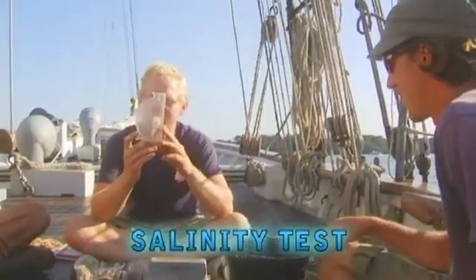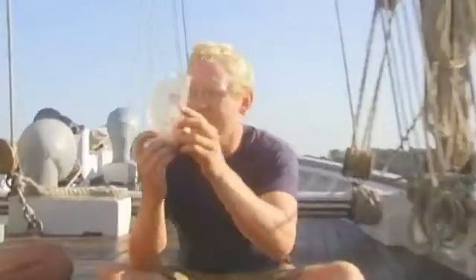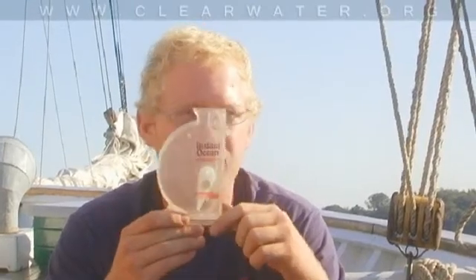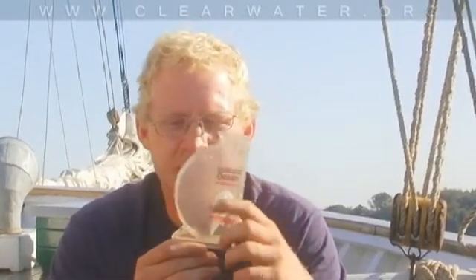Here's our salinity meter. Can you guys see the numbers along there? Zero, ten, fourteen, sixteen — those are the parts per thousand salt in the water. We'll fill this up with water and this little arrow is going to point to somewhere along the outside and tell us how many parts per thousand salt.